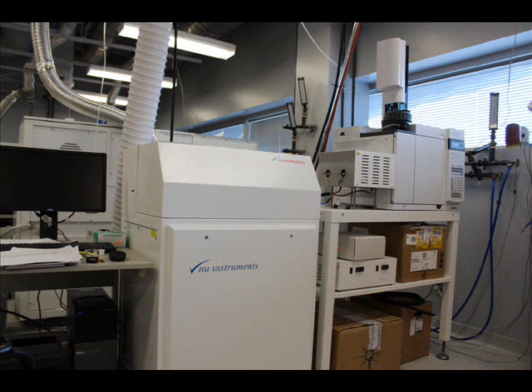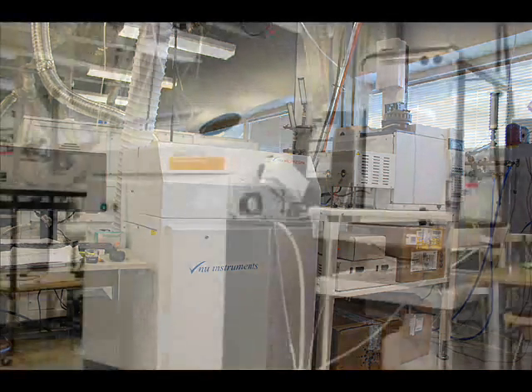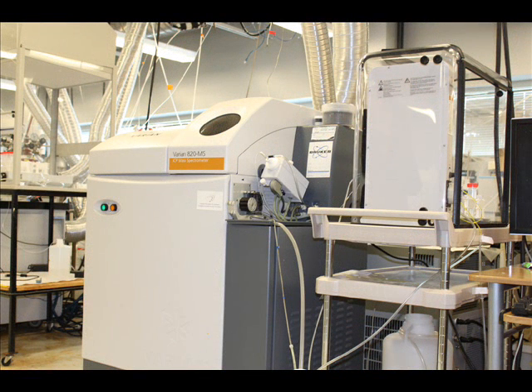In addition, the Horizon Continuous Flow GC mass spec enables us to do compound-specific isotope analysis, which can be used for environmental forensics, for example, to determine if PAH contamination is from natural sources or from anthropogenic activities. The Varian 820 ICP mass spec is used for analyses requiring very low detection limits, parts per trillion or even parts per quadrillion, and for integration with chromatographic separations, for example, to measure radium levels in water.